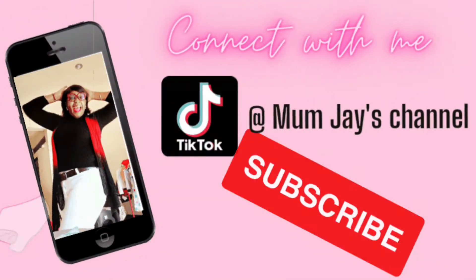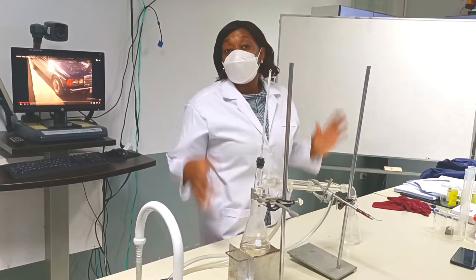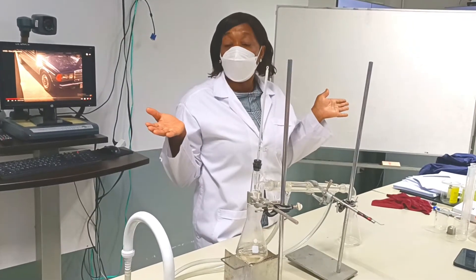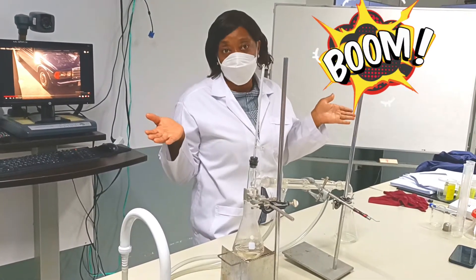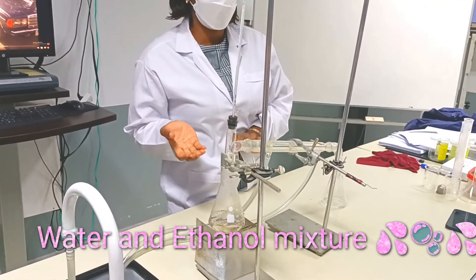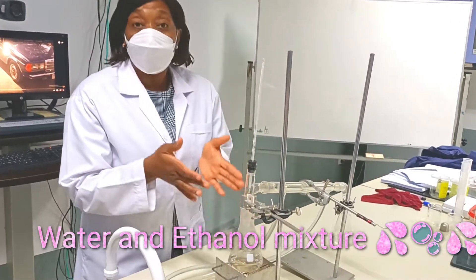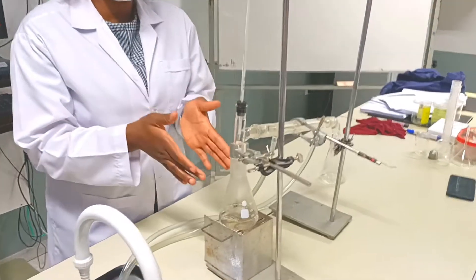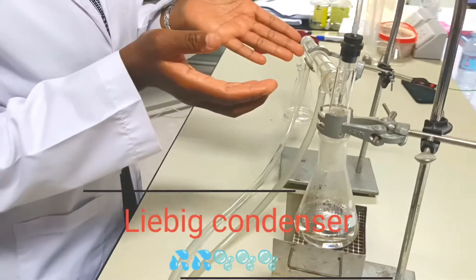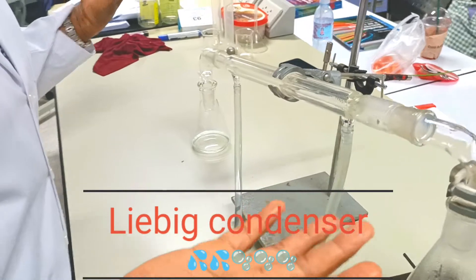Today we are talking about separation of mixtures or separation techniques. Today we are going to be separating water from ethanol. In here, I have a mixture of water and ethanol. I use this apparatus to separate this mixture.